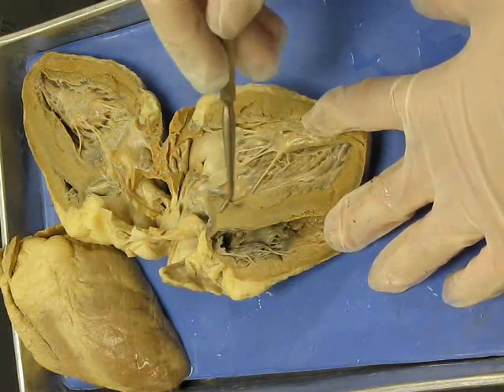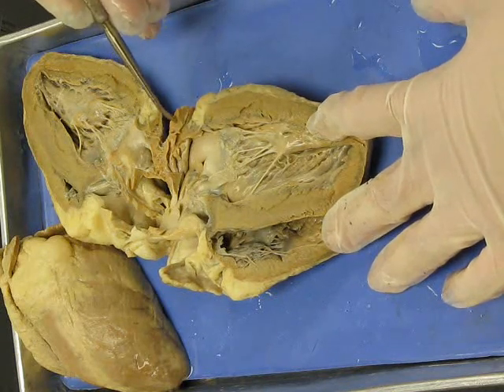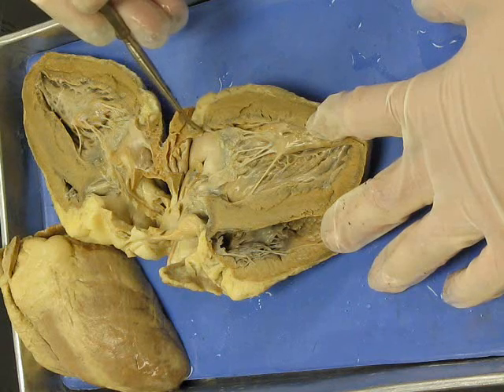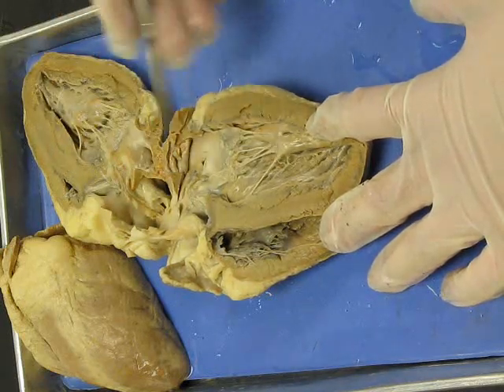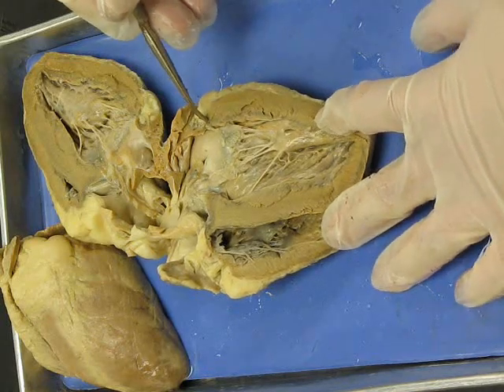Then you're going to have interventricular septum, atrioventricular septum between the atria wall and the ventricle wall. This would be 360 degrees all the way around the heart, dividing the top chambers from the bottom, so it'd be pinned right there, atrioventricular septum.